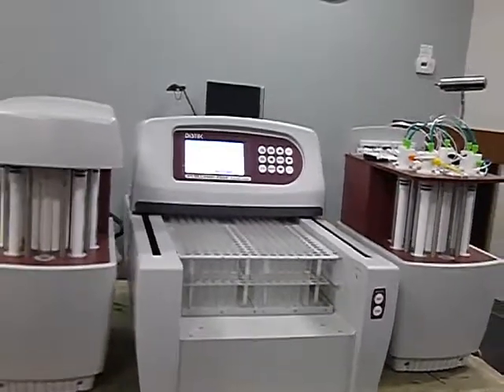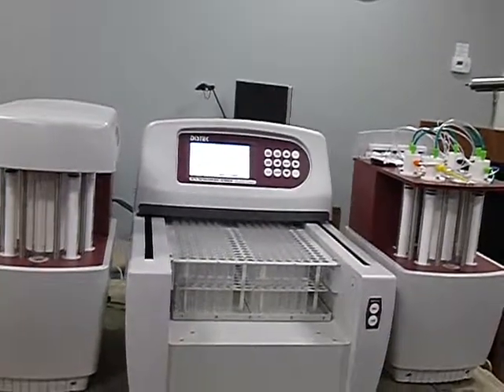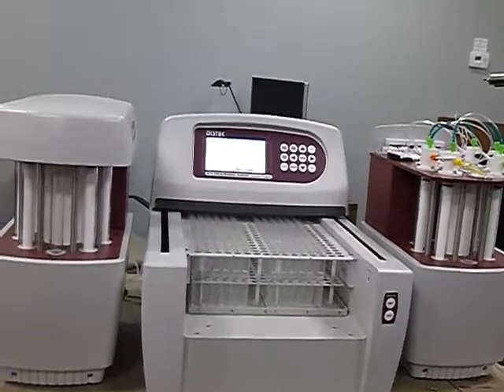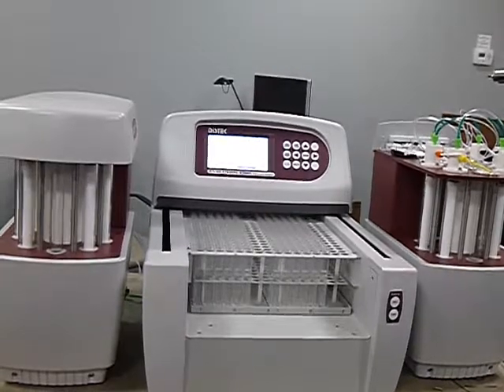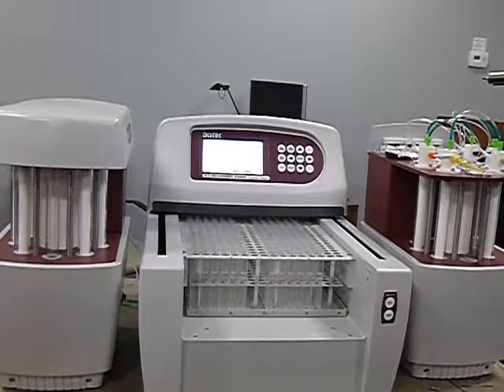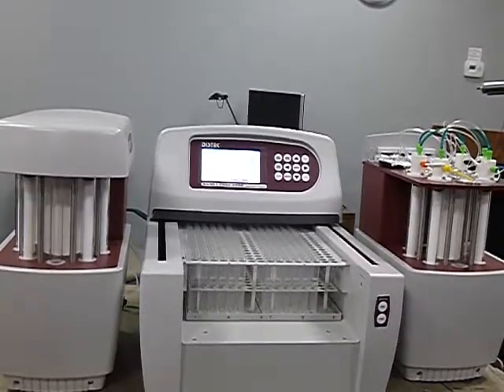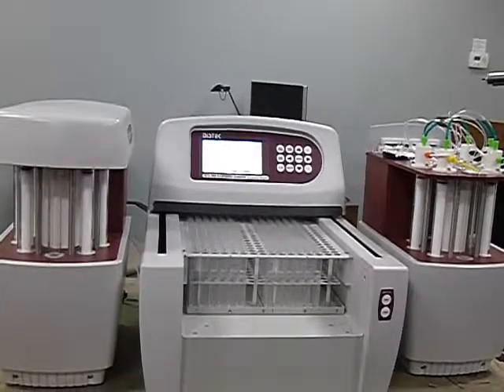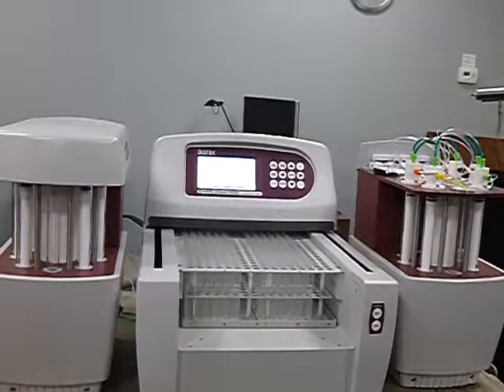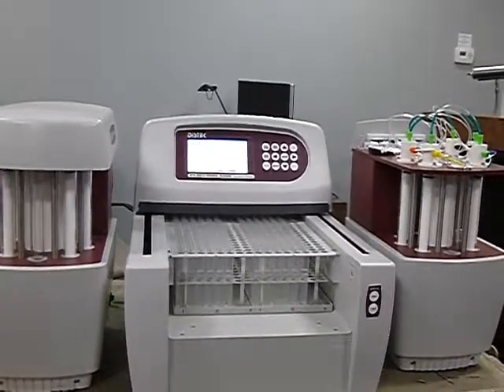You can combine the end of OQ1 with the start of OQ2. There was some combination where you don't empty the beakers and then put the water in. You can start with empty ones and do OQ3 first. That way it fills them up, and then when you turn around and do OQ2, 9 mils will be taken out.